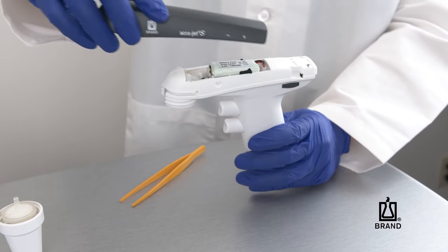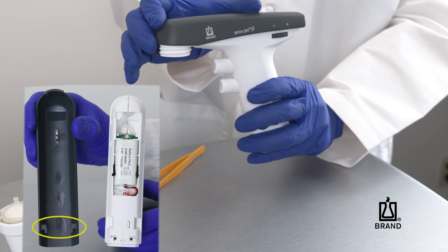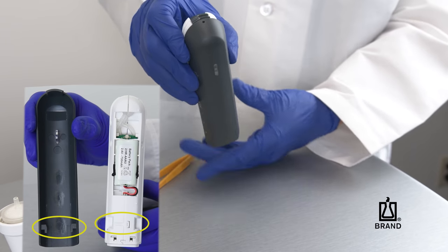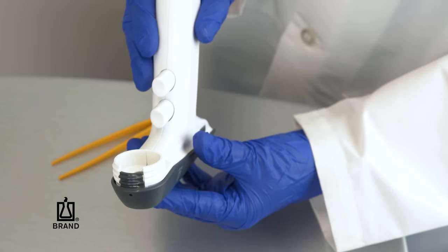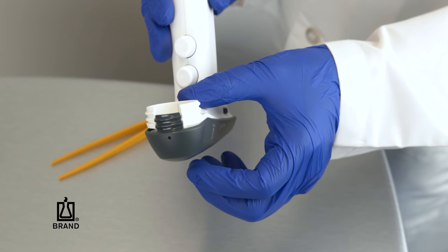With the battery in place, take the housing cover and slide it into place so that the clips on the cover fit into the slots on the AccuJet S. Now push the front of the housing cover down so that it rests flat across the top of the instrument.